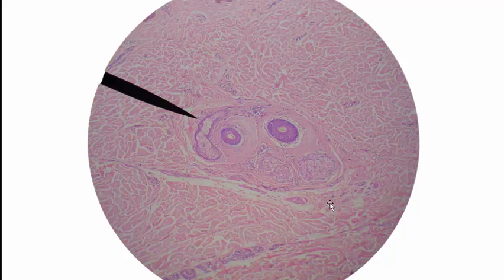And before I leave this image, way down below here, you can see the bottom of a sweat gland. Sweat glands are not always round, coiled things. They can also be elongated, I guess I should say. Also, while we're here, the major layer of skin that we're inside of at this point is the dermis. There's no epidermis in this image and no hypodermis. So on this slide, I could ask, what major layer of skin are we looking at here? The answer is dermis.